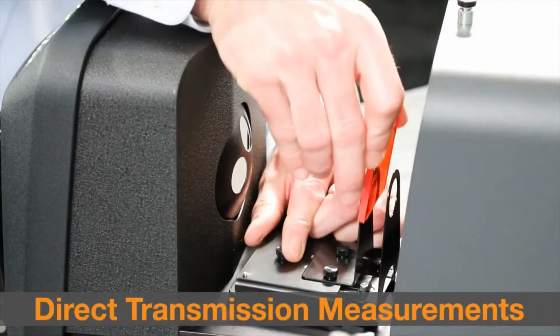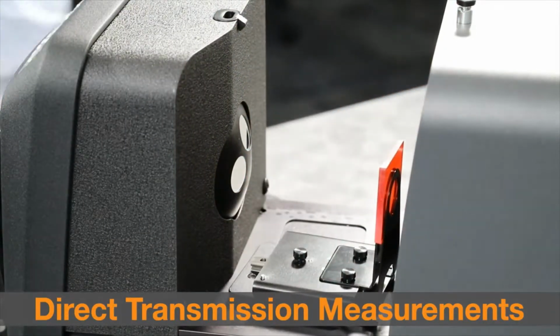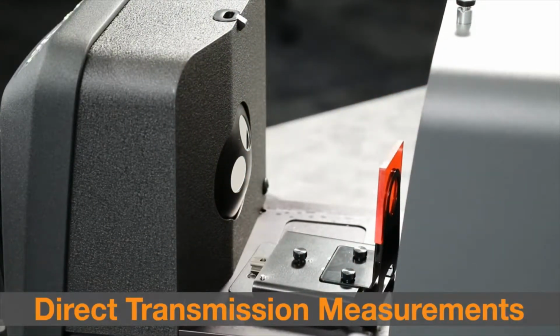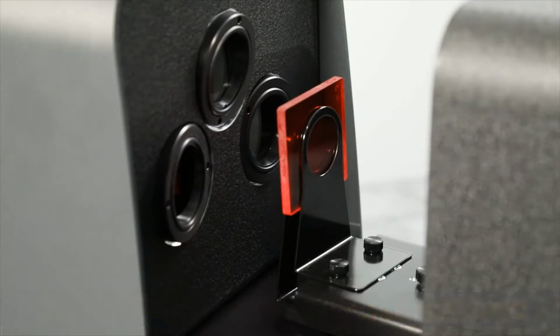Direct transmission is appropriate for measuring transparent samples which exhibit no scattering of light, such as samples colored with dyes rather than pigments. These measurements are taken with the sample positioned towards the lens in the back of the instrument. When performing direct transmission measurements, only the 25 mm clamp, stop, and aperture plate should be used.